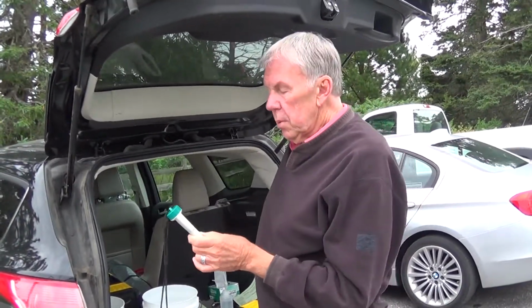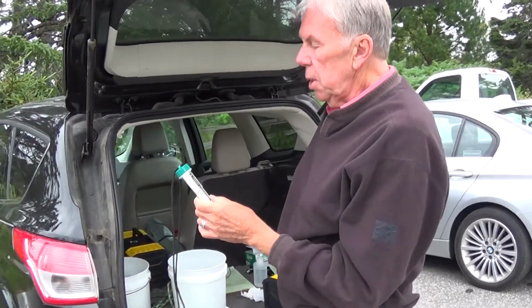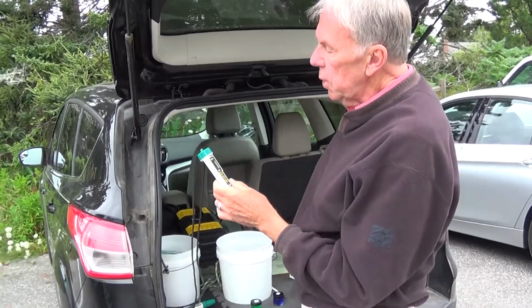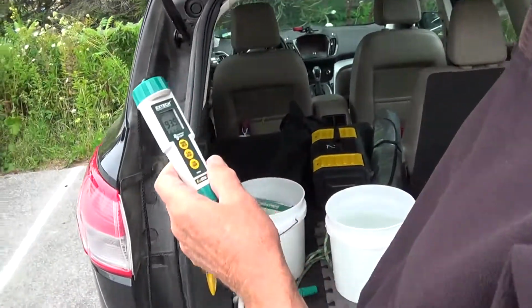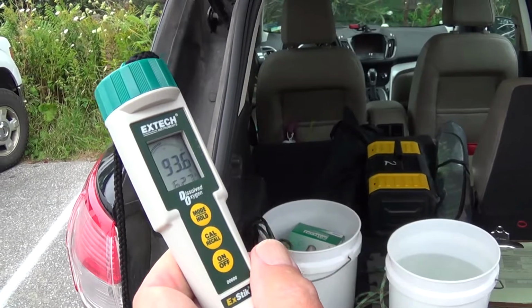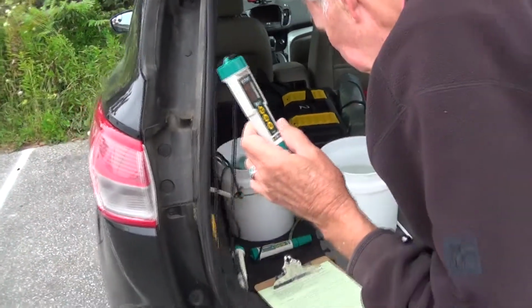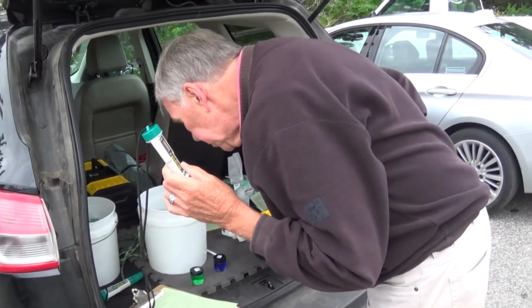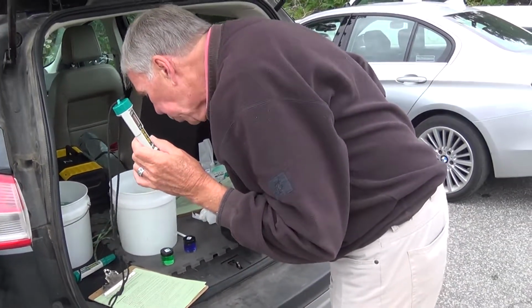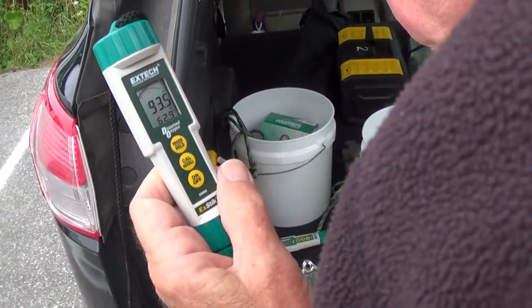All right, so this is set for a few minutes now, and it seems to have stabilized around 93.8 to 94 and 94.1, but anyway, we're at a point where we can begin. All right. So, it says press and hold the cal recal button until cal is shown in the display.